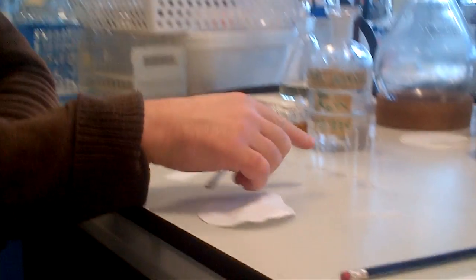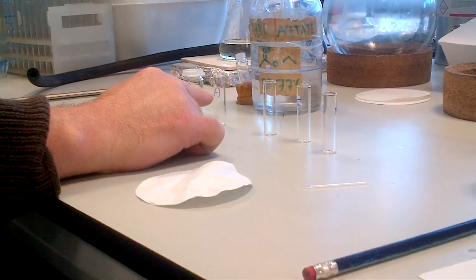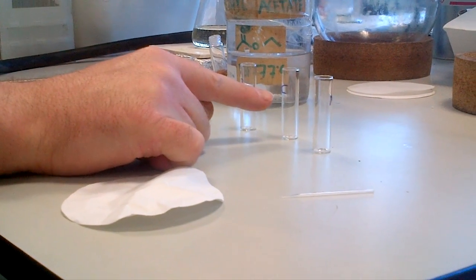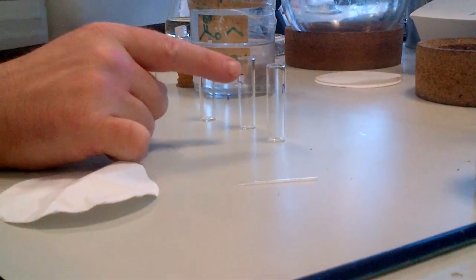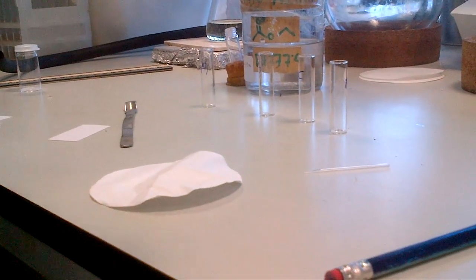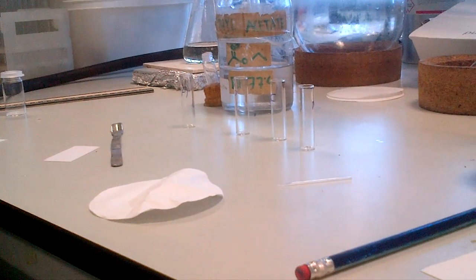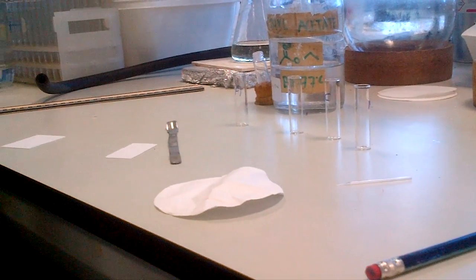For this practical, you've got to separate out aspirin, paracetamol, and caffeine. What we recommend is to have some clean vials set out and labelled as aspirin, paracetamol, caffeine, and the mixture. You'll have vials given to you in the lab of aspirin, paracetamol, caffeine, and the mixture, which you should then try to dilute into solution.